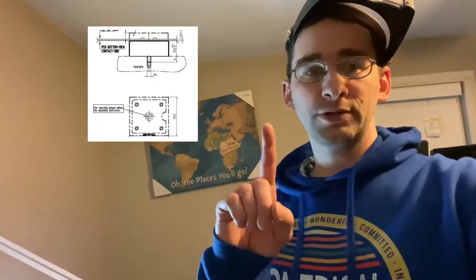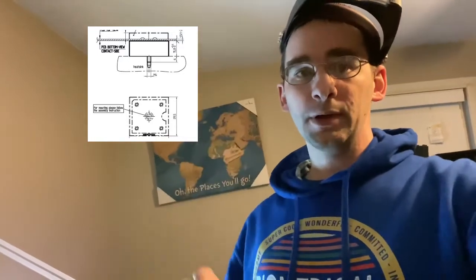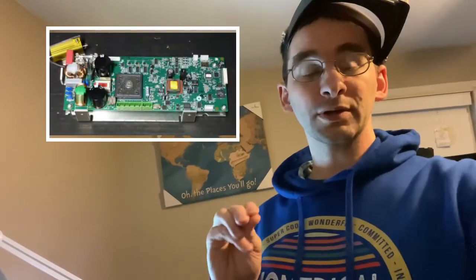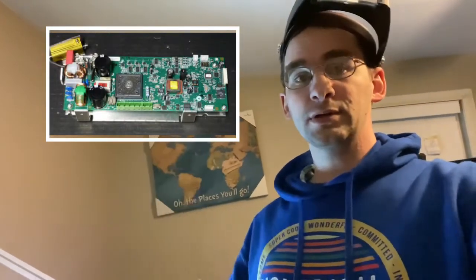It's really stupid simple. It takes one screw, and you have a mounted heatsink on top, so you sandwich it, basically. You have one side on one, and it's press fit. There's no soldering whatsoever. It's all spring-loaded contact. So you just unscrew it, take the other one off, put the other one back on, and screw it back on. It's got a locking hole, so you can't mess it up. You could try it, but it locks in the hole.